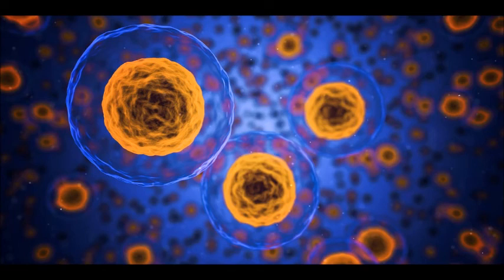I'm not sure what this gel substance could be, but I will carry out this test for uracil once I obtain the reagents to do so.